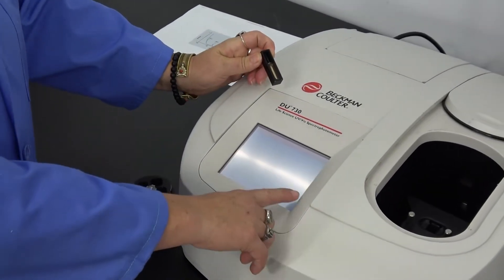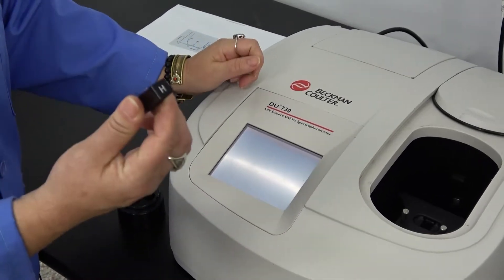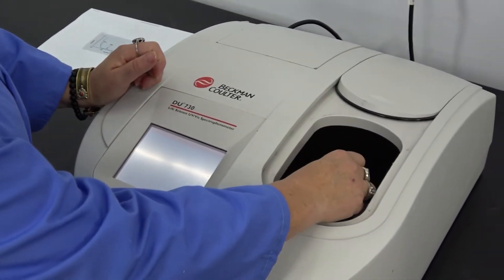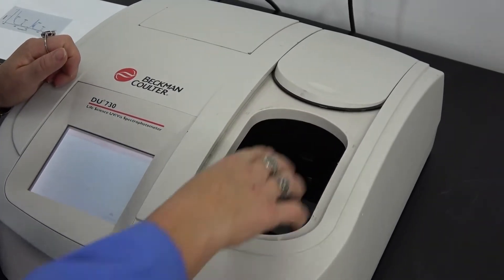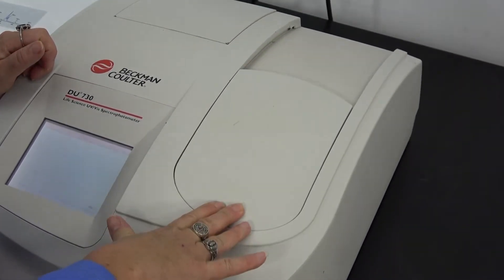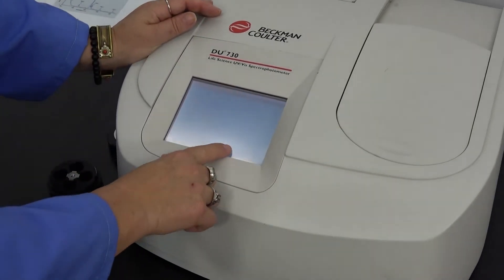We've already run a blank to get a baseline. We're going to run our Holmium standard, load that up. The beam runs back to front, close that door, hit read.